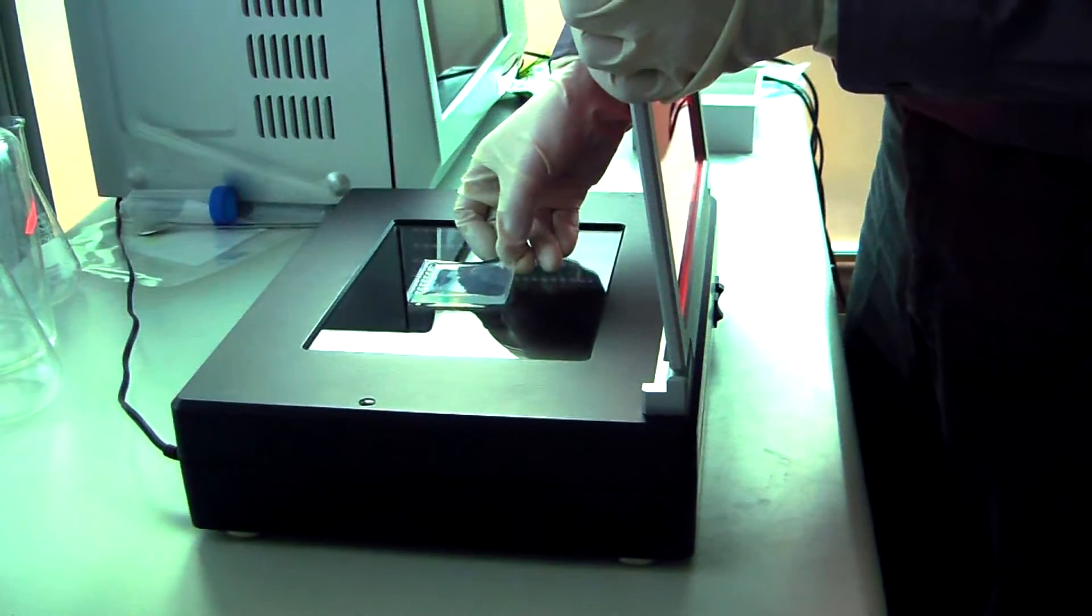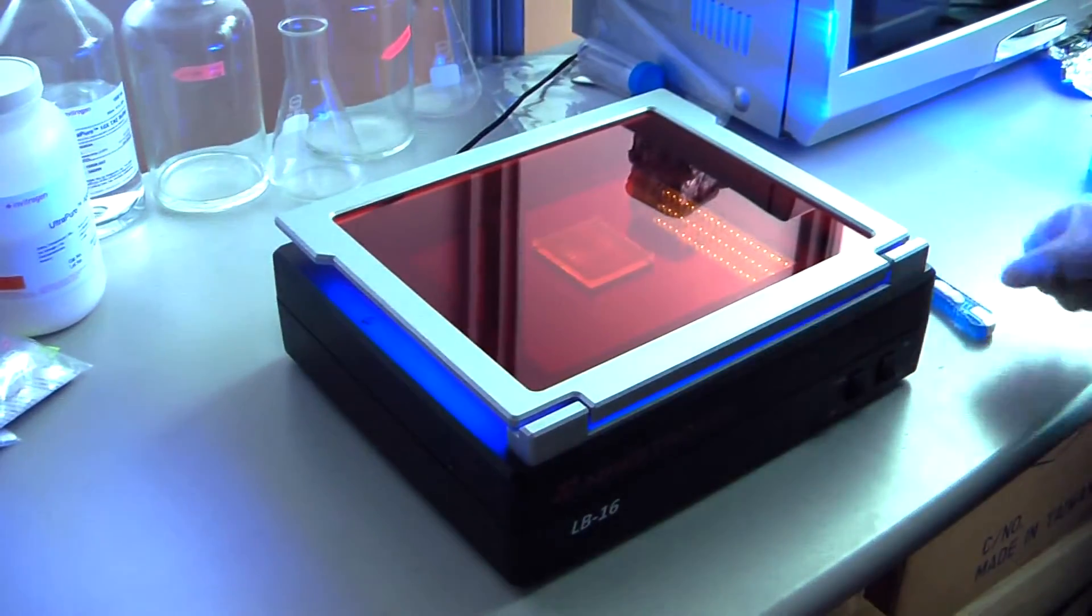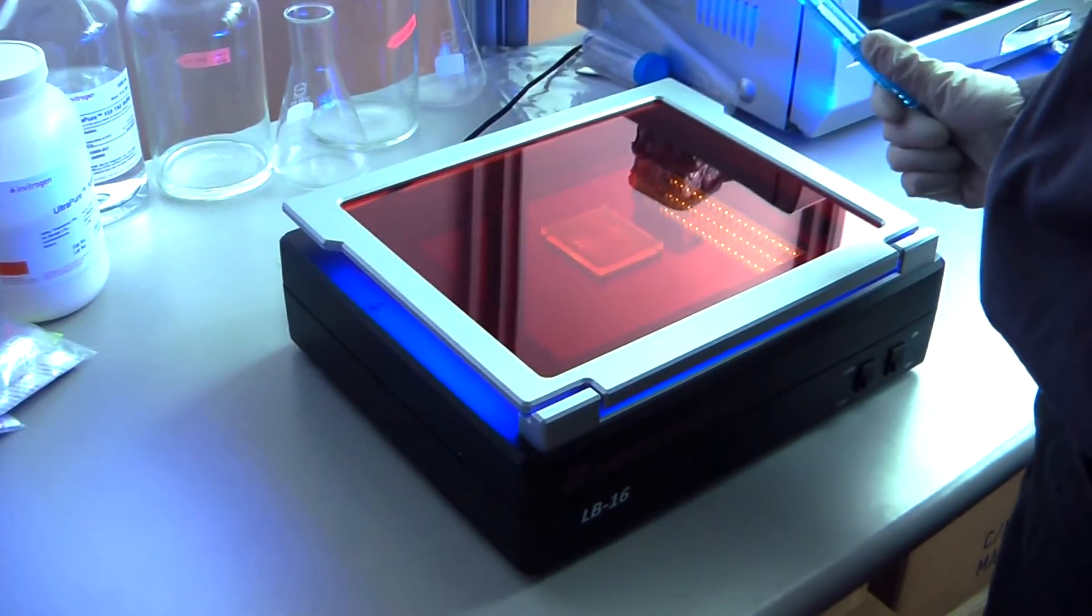Stained DNA gel is put on the glass support to observe the fluorescence. Turn on the power, rotate the frame of the amber filter to a suitable angle for observation. No need to hold the filter; both of your hands are free for gel cutting.